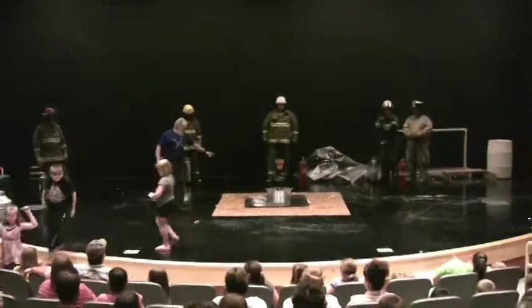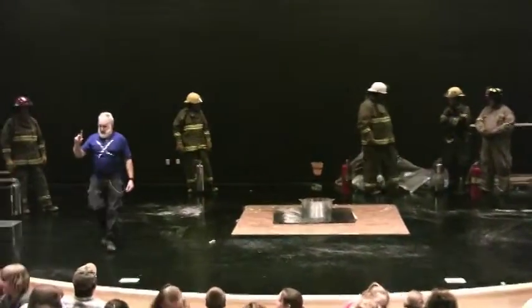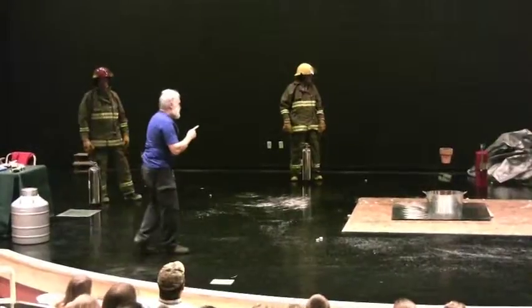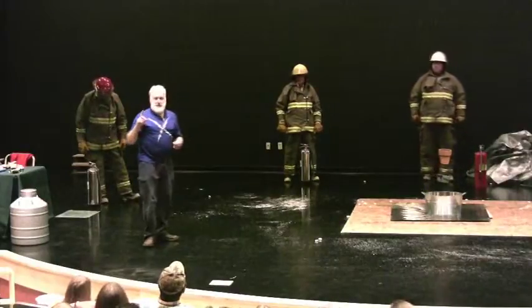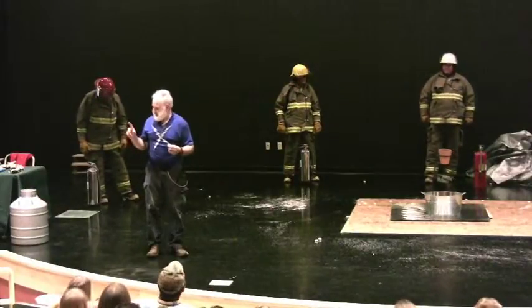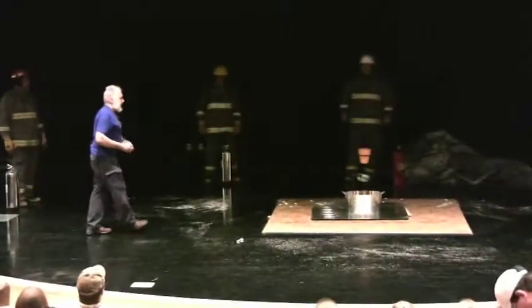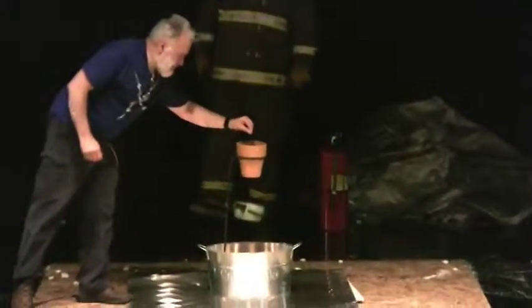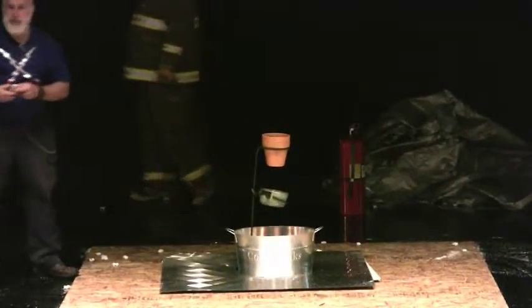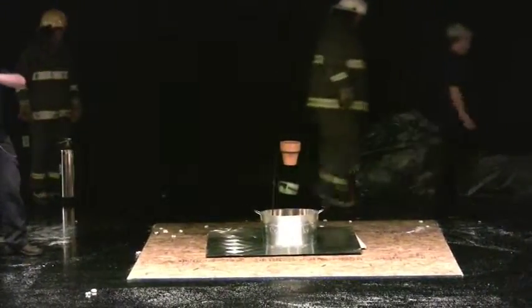And when they're connected together in the pot there — because I have never done this indoors — I have firefighters standing by. I more or less expect the fire alarms to go off. These guys are ready to take care of whatever problem develops. I have inserted in the mixture of aluminum and iron oxide a magnesium ribbon. Magnesium is another metal, and it burns in very bright light. If it feels too bright for you, close your eyes and look away.